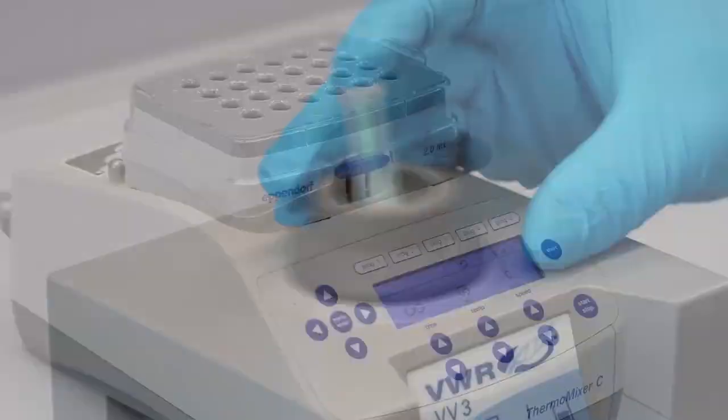Incubate the sample for 10 minutes at 65 degrees Celsius and vortex occasionally.